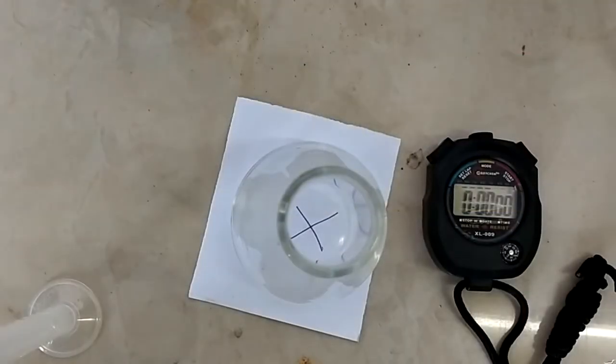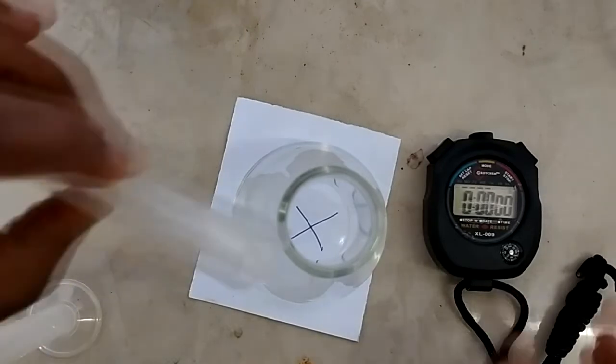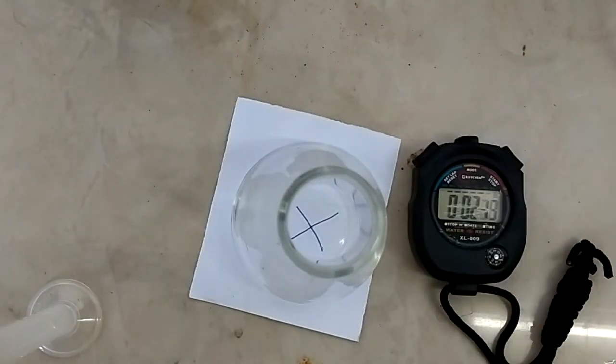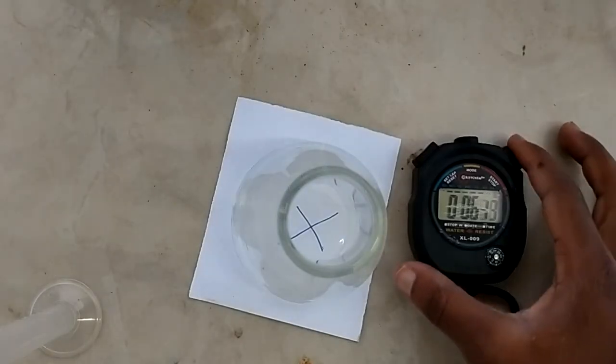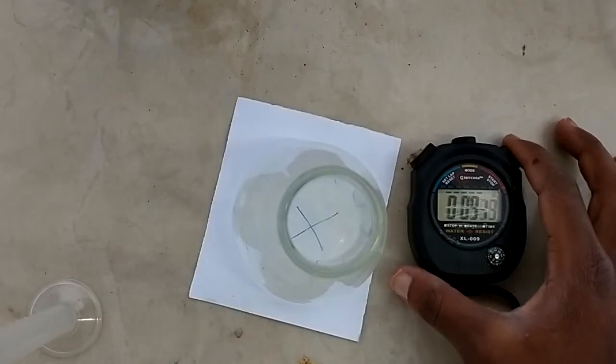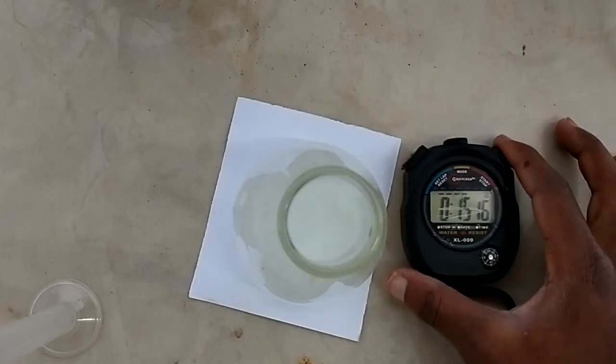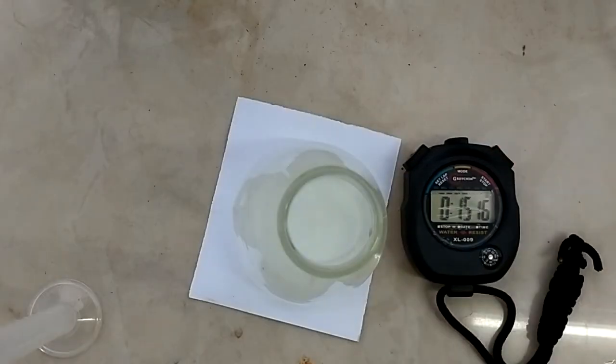Great, now at 40 degrees Celsius. And there you go, 15 seconds.